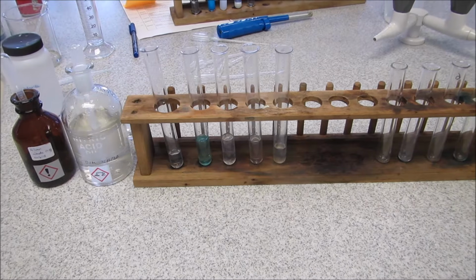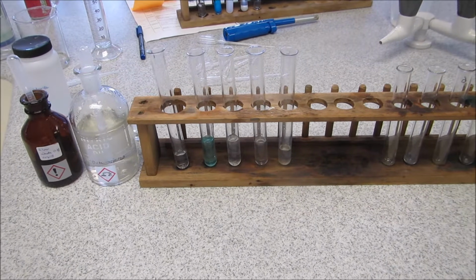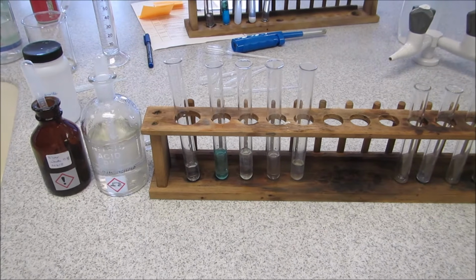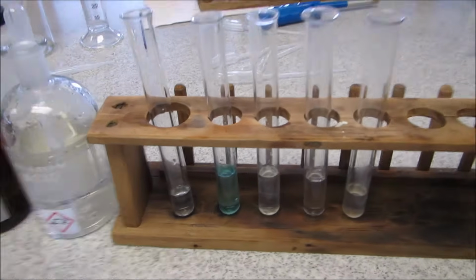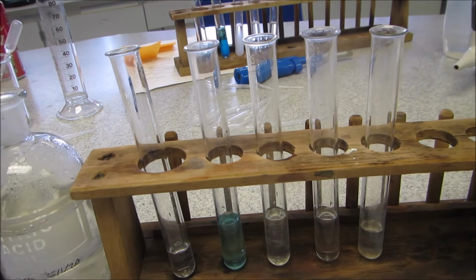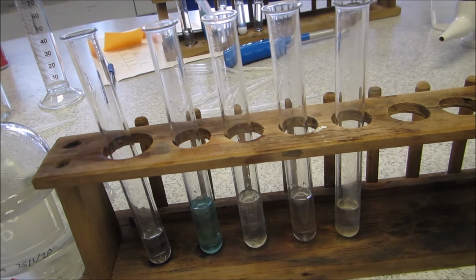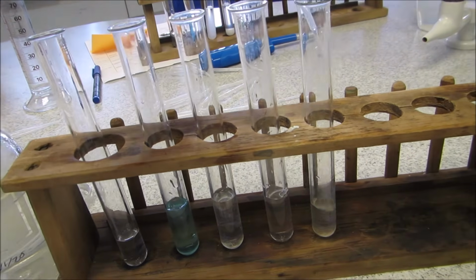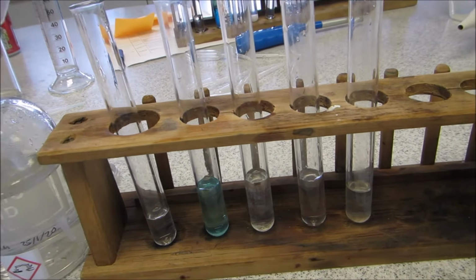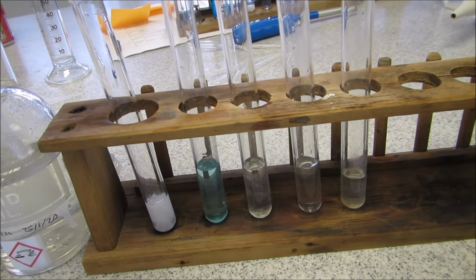So for the anion tests, we are going to test for halides, for carbonates, and for sulfates. So the first thing I'm going to do is to test for the halides, and then if any of them react, we know we can rule them out. So I'm just going to add a bit of nitric acid. Again, I've measured out 1 of each of the 5. Just acidify it with nitric acid. And then I'll add silver nitrate, and we'll see if there's a reaction.